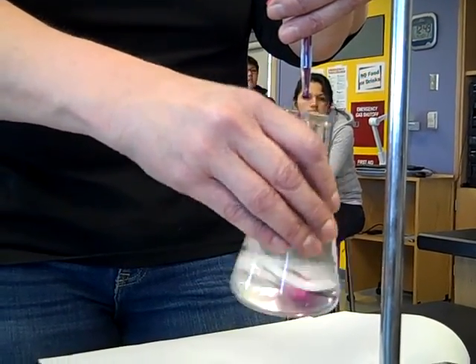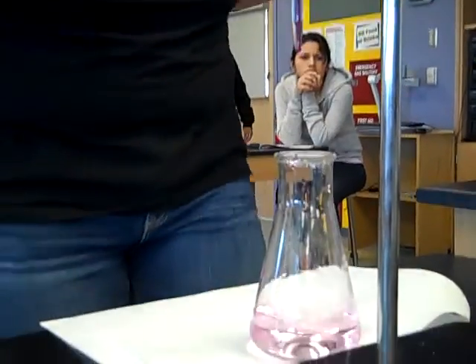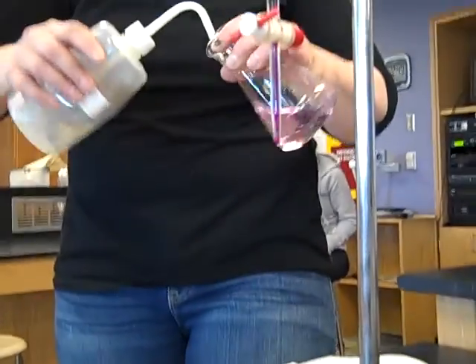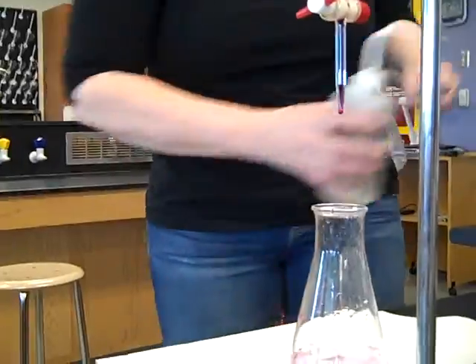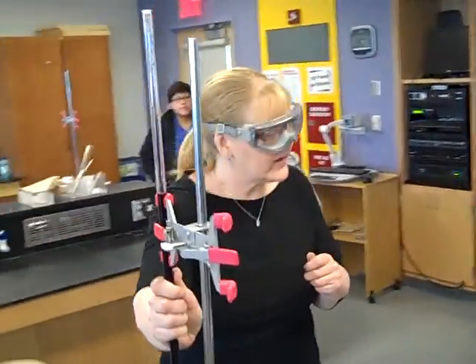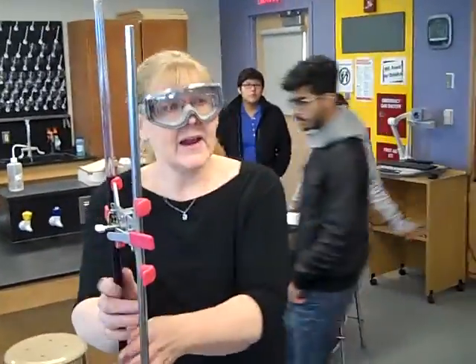Be slower when you do it, and you'll get a pale pink endpoint. To verify that you're there, you're going to want to wash the sides down. You're looking for pale pink. At this point, the permanganate is in excess — just a little tiny bit extra, but not enough to mess your math up. And you can do your calculations.